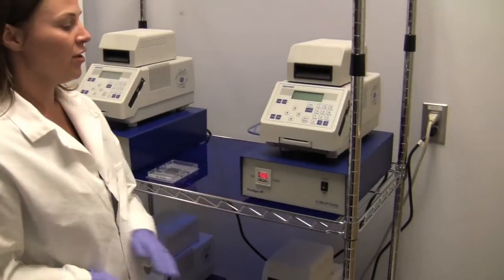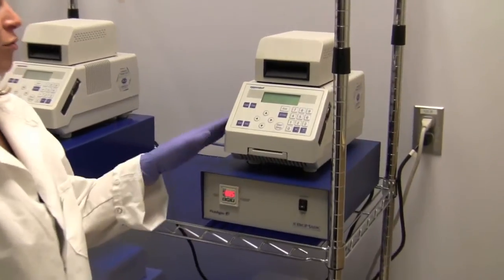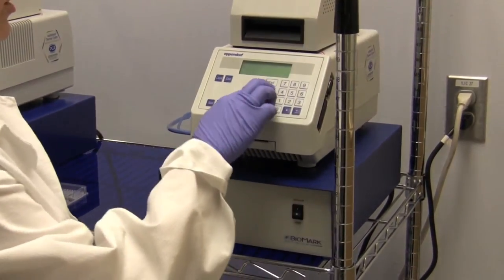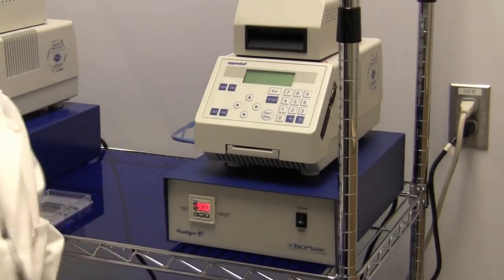Turn on the vacuum. The thermocycler will turn on, and I will just start the thermocycling protocol.